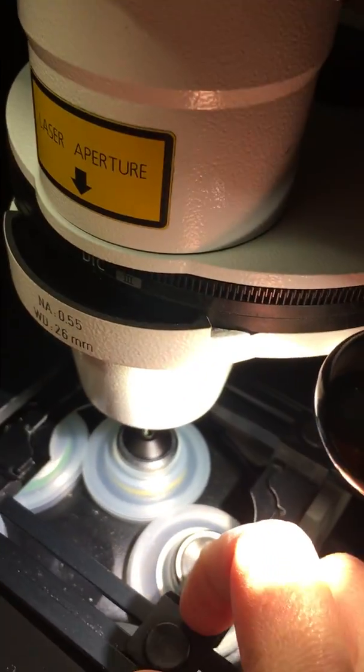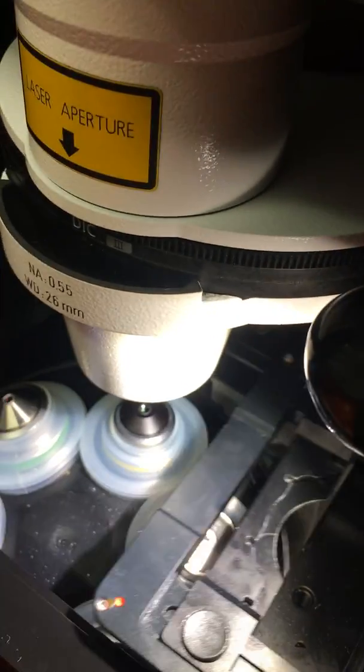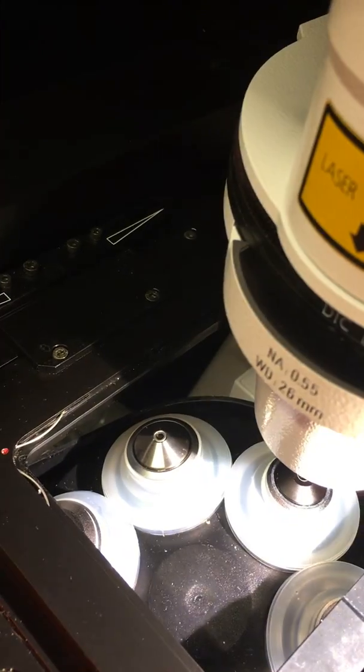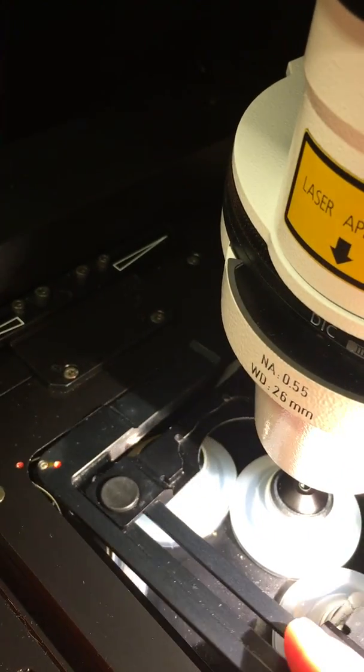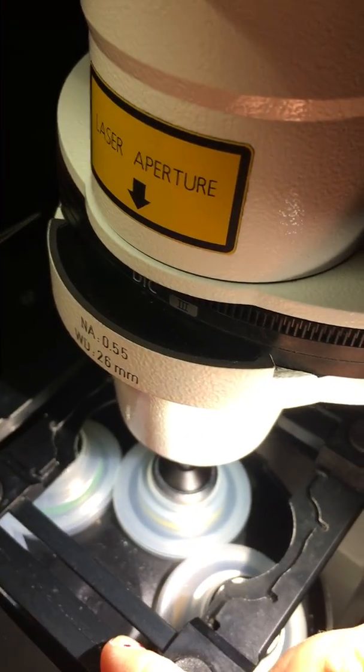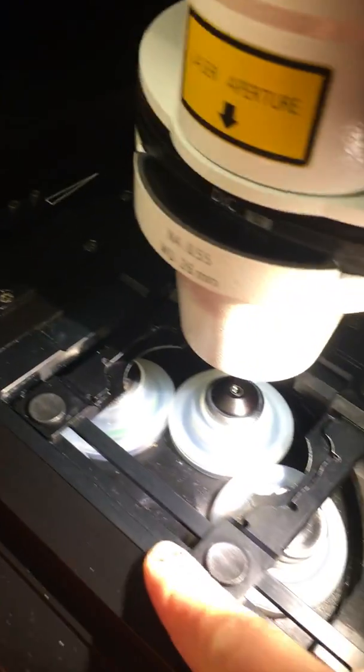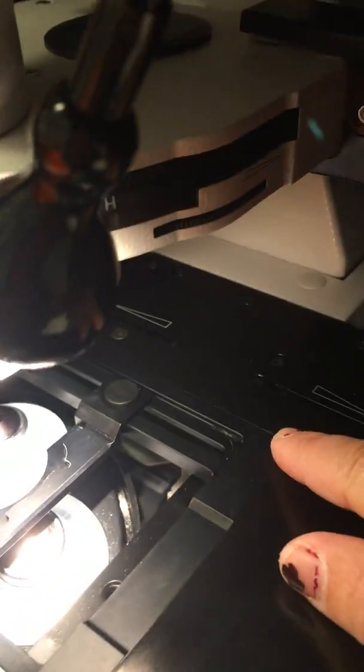This frame is held by two springs in this corner. You need to match this red dot with a red dot on the frame and then gently push both springs simultaneously in until the frame clicks in nicely, like this. And then please check that it's leveled with the stage on all four corners.